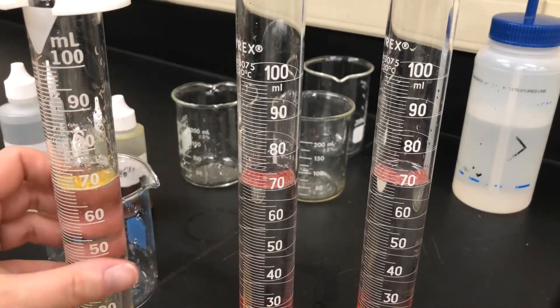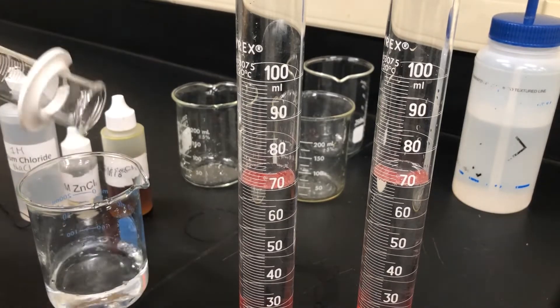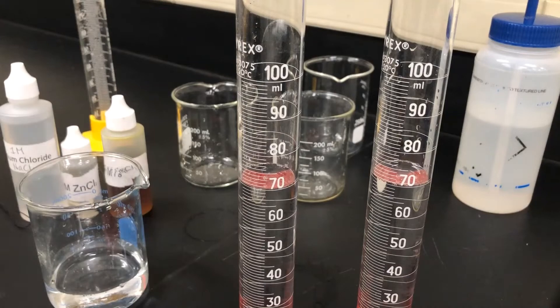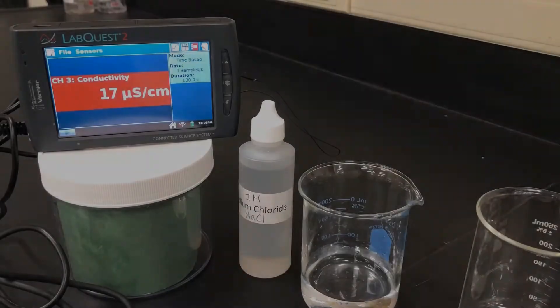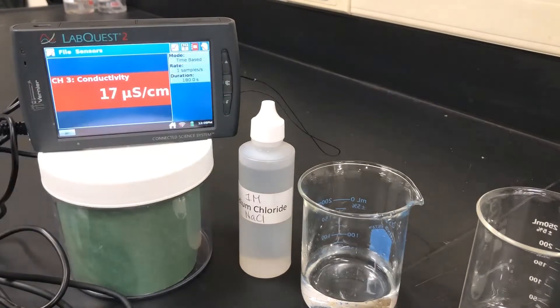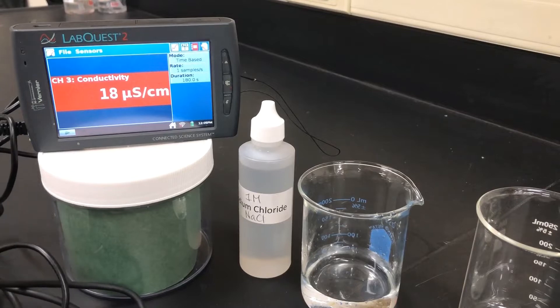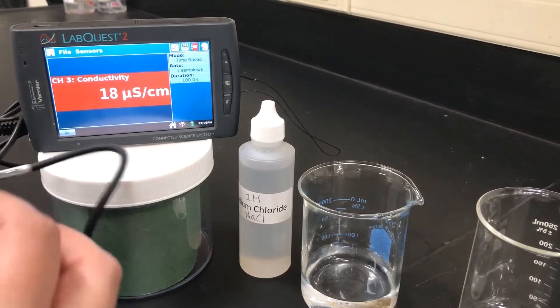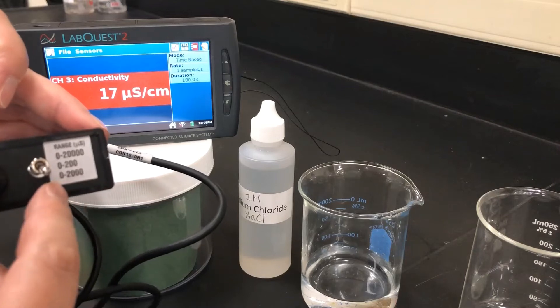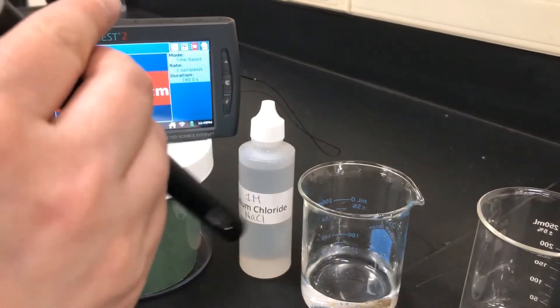Each graduated cylinder we will pour into a beaker that we will use for either sodium chloride, zinc 2 chloride, or iron 3 chloride. For our first trial using sodium chloride, please be sure to look at your conductivity probe and make sure that the toggle is at the zero to two thousand mark in order to get the correct reading.